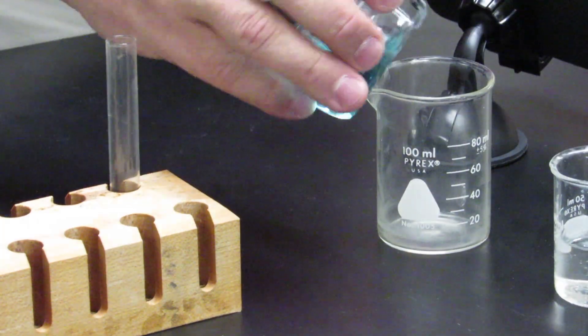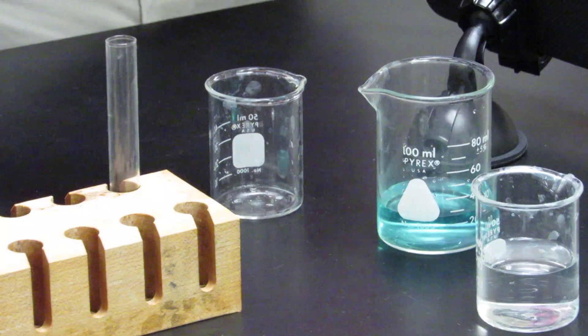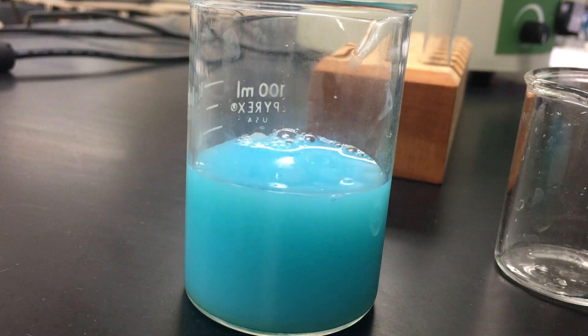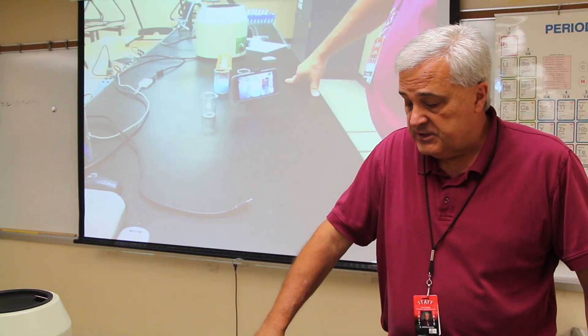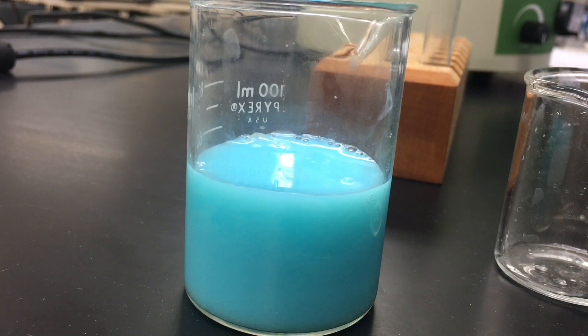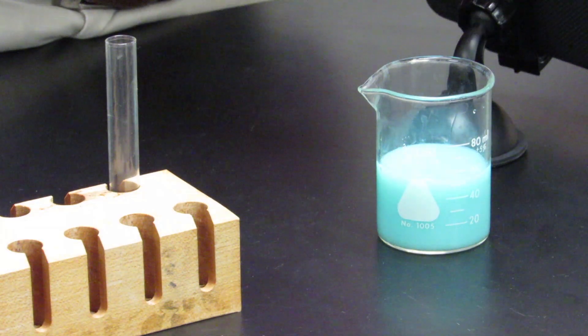If we put the copper sulfate into the beaker and add the sodium hydroxide, the reaction is going to precipitate out a small solid. You can see now we have a suspension, and if we let it sit long enough, eventually it would form layers as you would expect in a suspension.